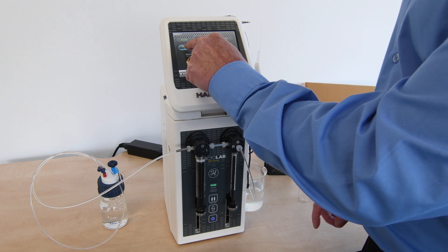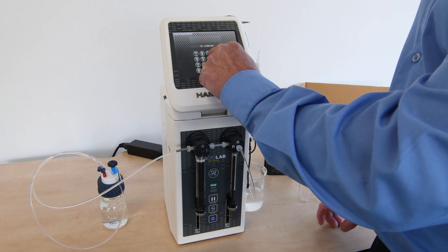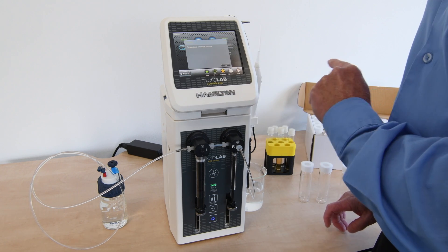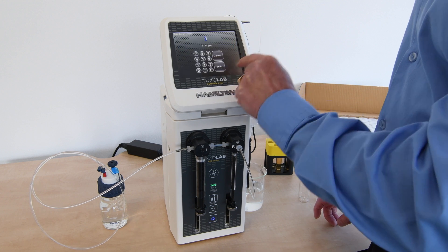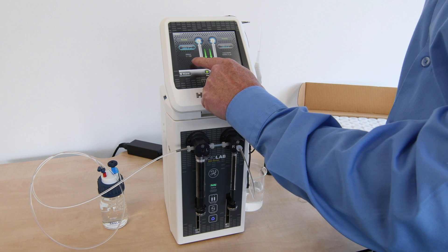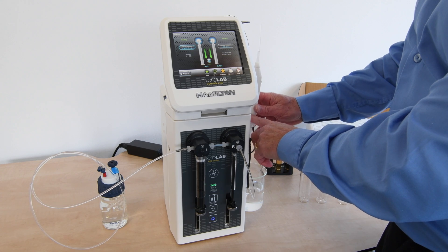We're going to put in the diluent volume — 4,900 microliters. And now it asks us to put in the sample volume, and we'll put in 100 microliters. Quite clearly you can see this is a 1 in 50 dilution, so we'll look at that in use.